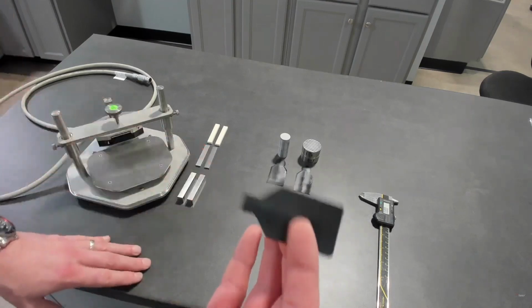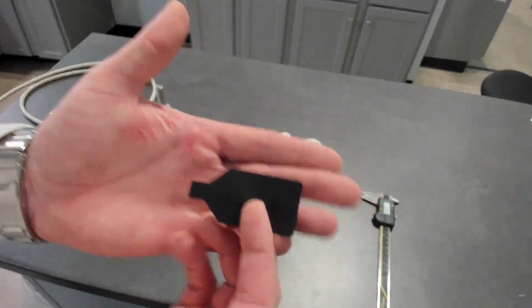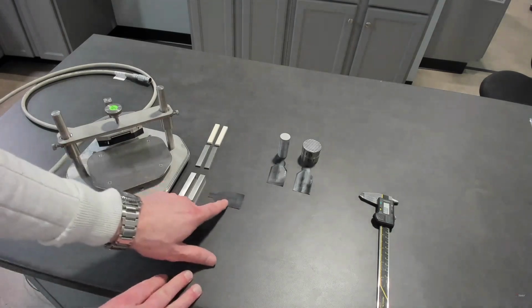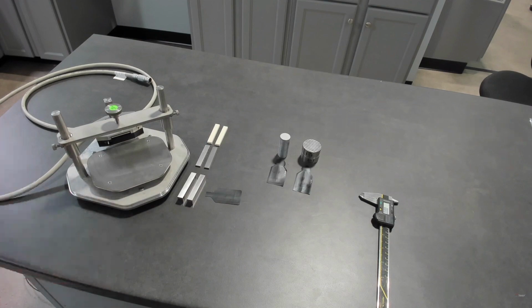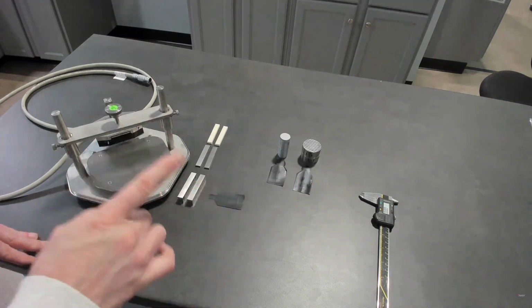The one we're going to talk about today is 10 by 10. In the configuration of transient hot strip, you have all the same capability to measure bulk values, anisotropic values, slab values, all the same orientations, but specific to the transient hot strip with a few unique advantages.